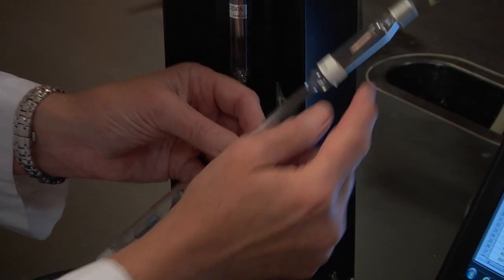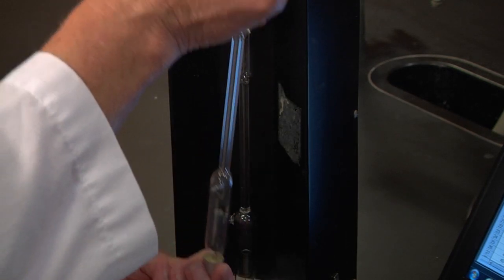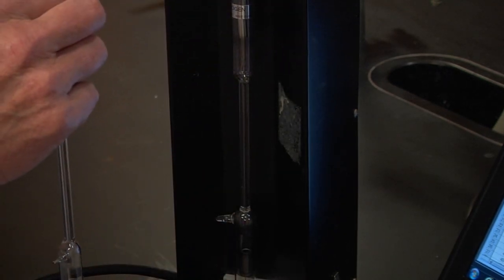We have an electrode here, an electrode here, and we're going to put this in our high voltage power supply.